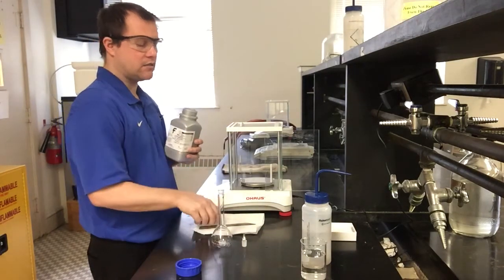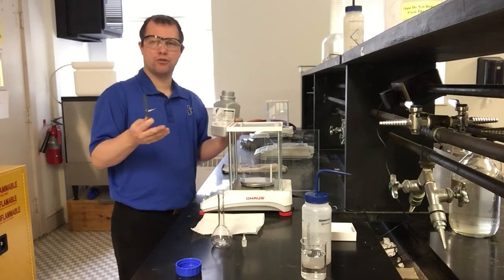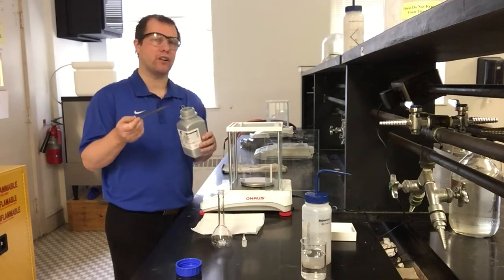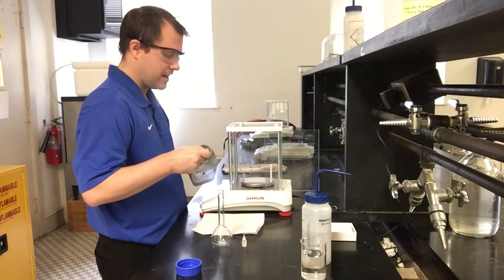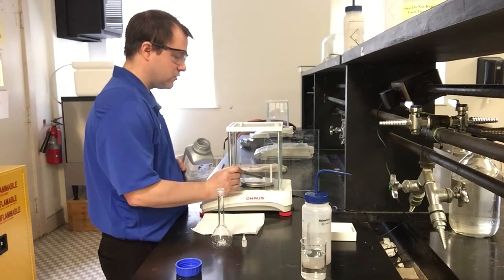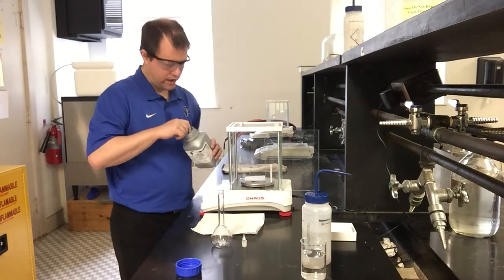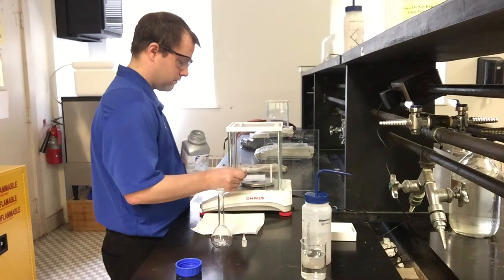And unlike some labs where the amount of your particular reagent you're starting with doesn't usually matter as long as it's somewhere close and you record it, this time we actually do want to be very, very precise. So you want this as close to 1.47 grams as we can possibly get it. And I'm going to try really hard not to go over that, because it's much easier to add little tiny bits than it is to try and take some off. So it's still only right about 1 gram now, still a little less than a gram. So I'm going to add a little bit more.